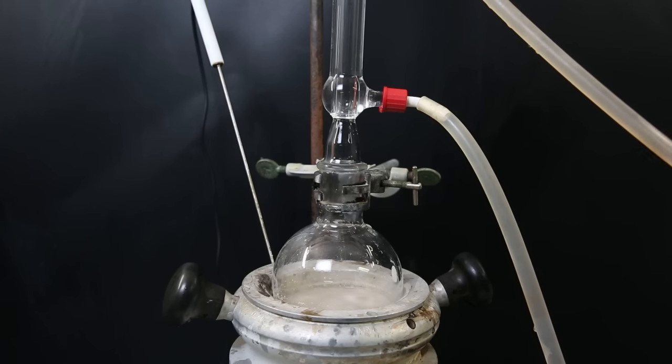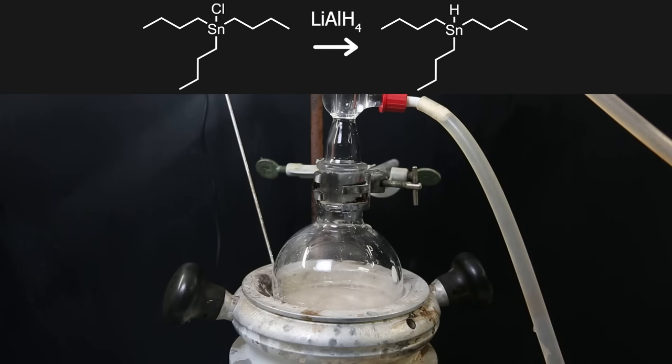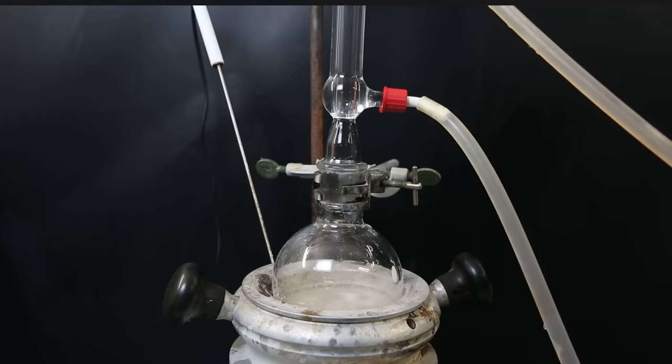When all of it has been added, I set the flask in a heating mantle and reflux the mixture overnight. In this reaction, the lithium aluminum hydride will simply donate a hydrogen atom and take up the chlorine atom to produce tributyl tin hydride.